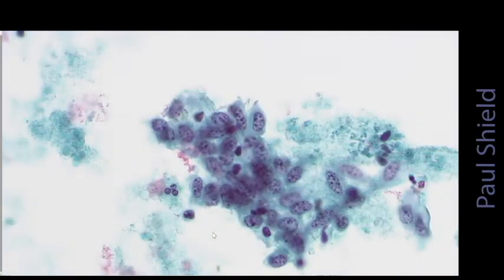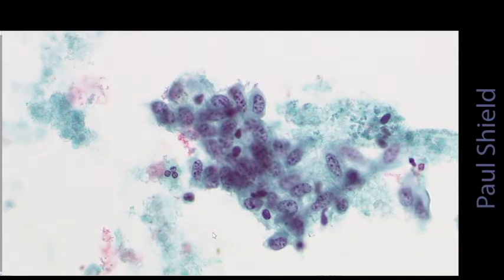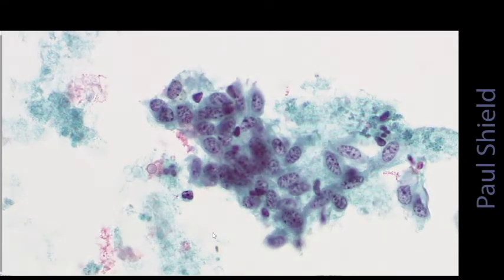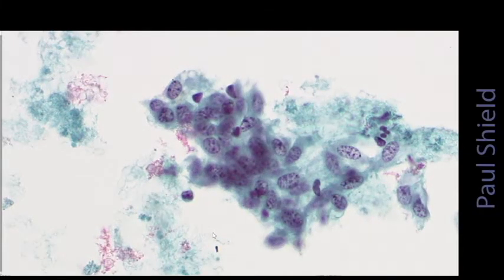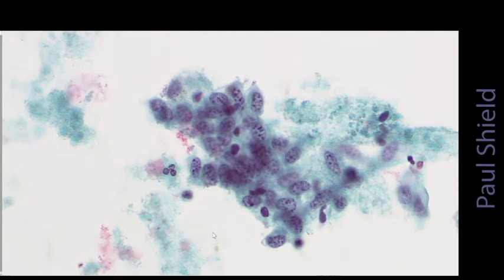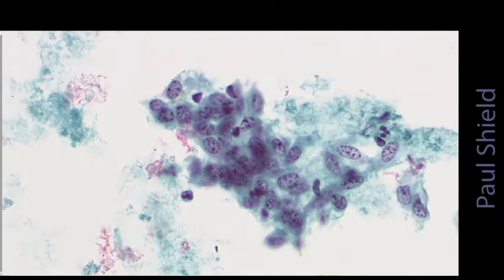Here you can see a really loose group of endometrial cells. Notice these are a little more oval or elongate shaped. Notice the chromatin on these, which we would call stippled. As well as having a fine background to the chromatin, you can see dots of chromatinic material as well, like someone's shaded it in with dots. Notice the nuclei are overlapping here, and the cytoplasm has no distinct borders to it at all.